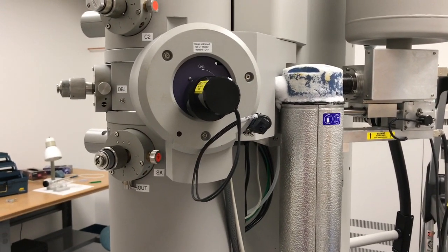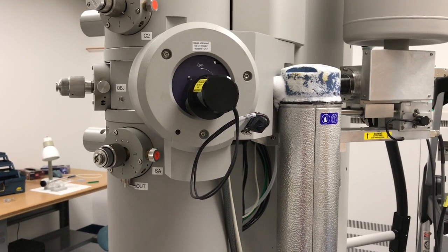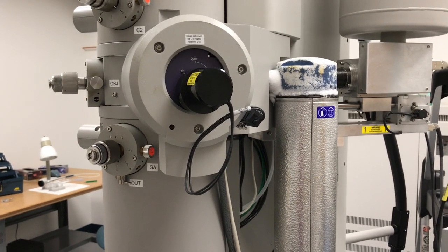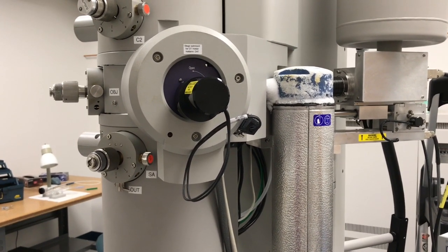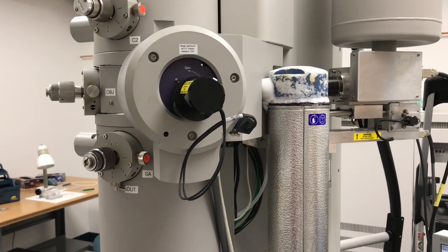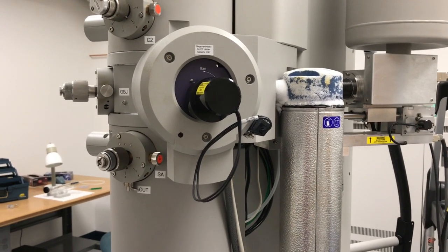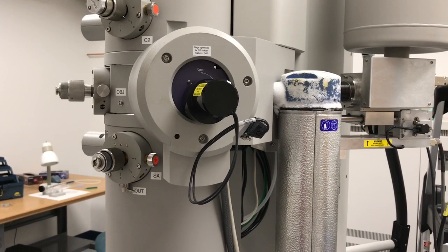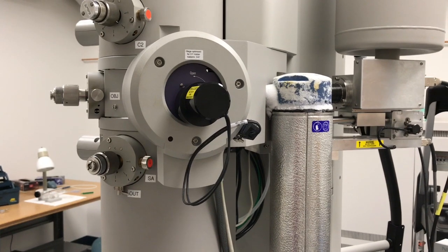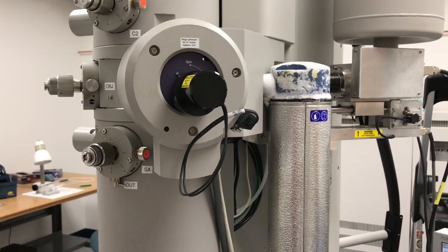This demonstration is going to cover what's known as two-beam imaging. So the first thing to clarify is that two-beam imaging is always done within the context of usually a single crystal specimen or a single crystal region within a specimen. The specimen that we have today is a single crystal of silicon that has been ion implanted and subsequently annealed, and as a result has small faulted dislocation loops in it, which provides basically an ideal specimen to test out and demonstrate two-beam imaging.